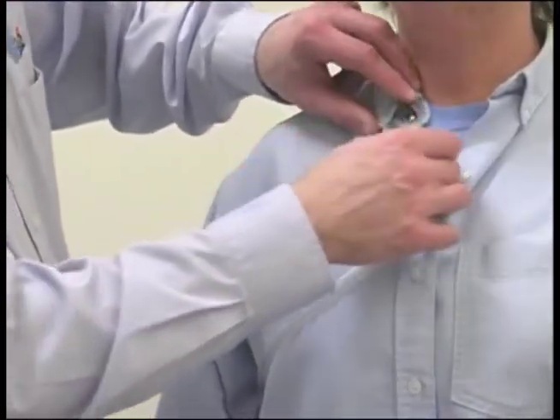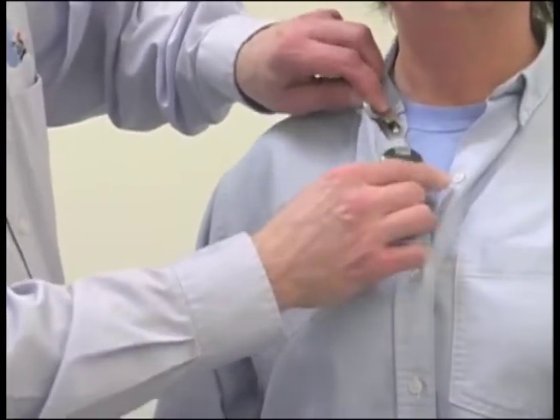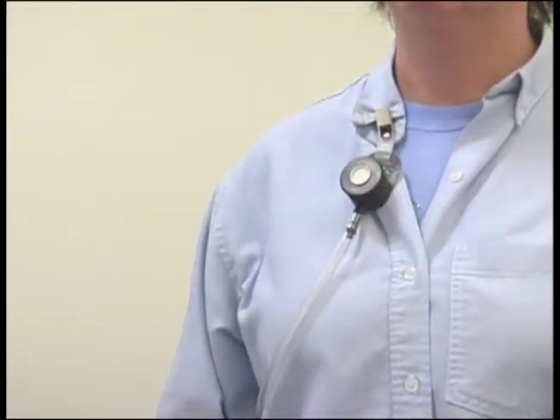Also, ensure that the sampler inlet is facing away from the worker. Sample for the time specified in the method.